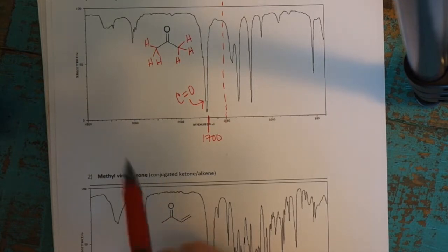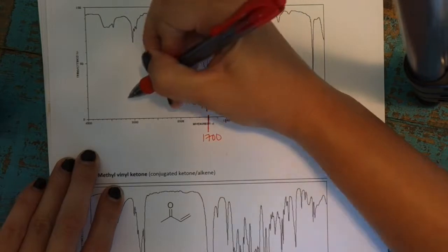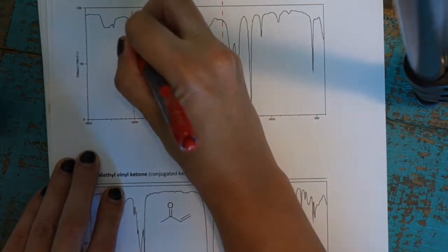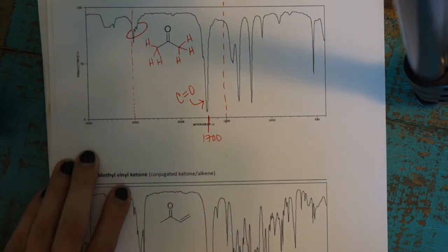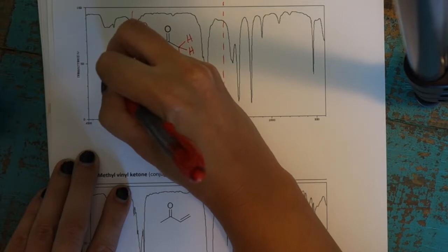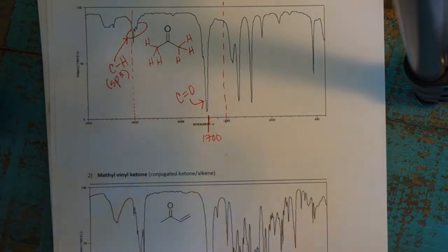So what we would expect to see in our spectrum is all of our CH stretching to be to the right of 3000. And 3000 is right here. Again, I'm going to draw a little line. You can see our CH peak is this stuff right here. It's not one strong sharp peak, it's kind of a jumble of stuff. It's jagged, not super nice and sharp like the other peaks. That cluster of peaks represents our alkyl or sp3 CH bonding. And we don't see any other types because that's the only type in this molecule.